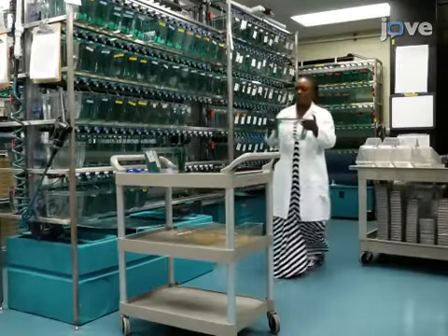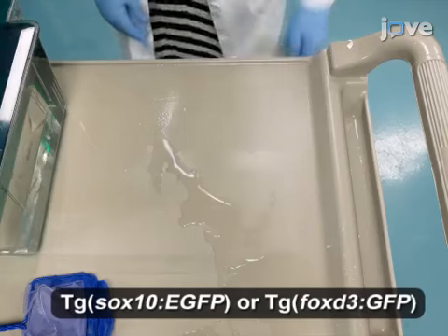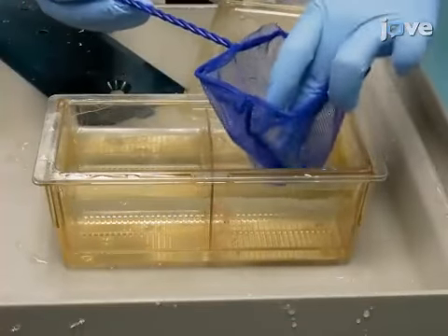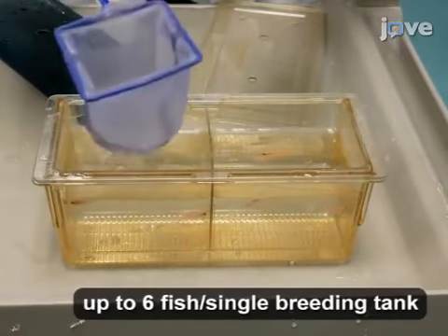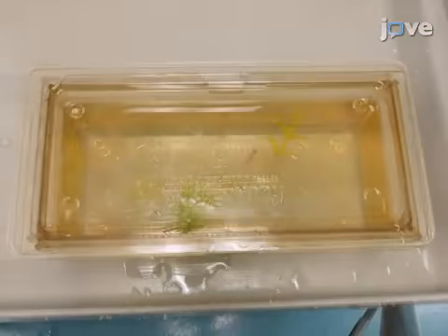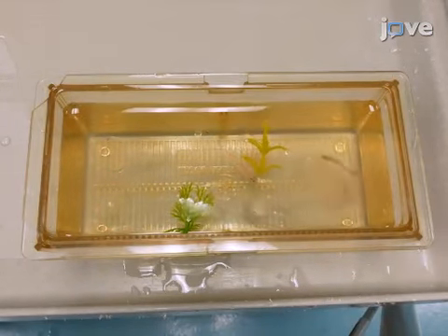To set up for embryo collection, between 3 and 9 p.m., assemble breeding tanks and fill them with reverse osmosis or RO water. Transfer up to 3 females and 3 males into opposing sides of the divided tank. The next morning, remove the divider shortly after the lights turn on in the vivarium. Allow undisturbed mating for 20 minutes or until sufficient numbers of embryos are produced.